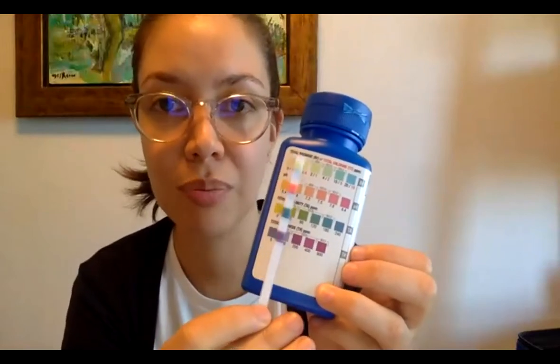Okay, so I have my readings for my little test strip. Usually this test, we say, is best done with 2 people because we all read colors quite differently. When you have somebody else validating your results, that's always best. If you don't have someone, that's fine too. We always tell people to start from the lower end of the scale and slowly bring up to see where it matches. So you want to do one at a time.